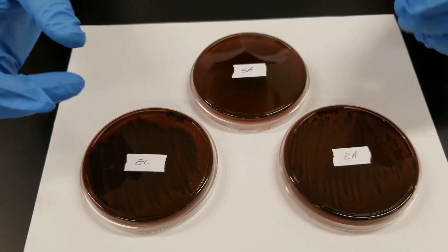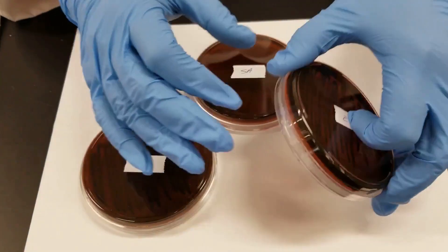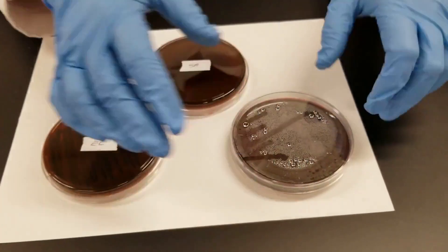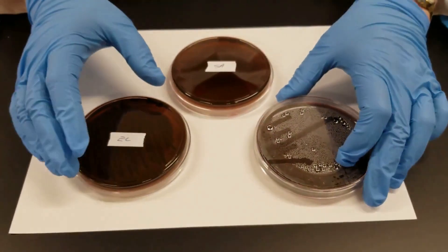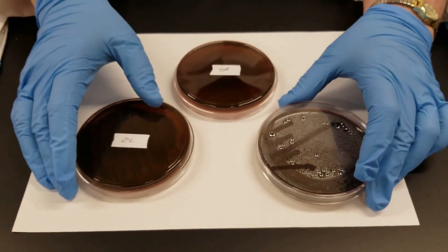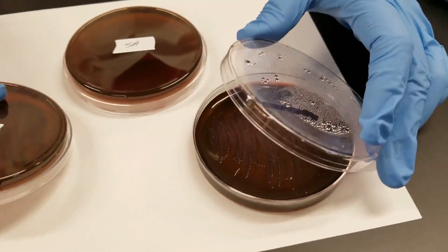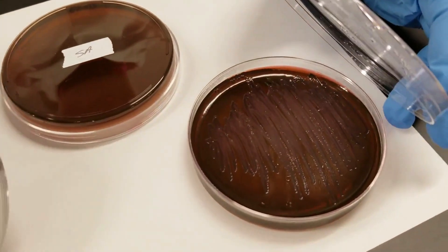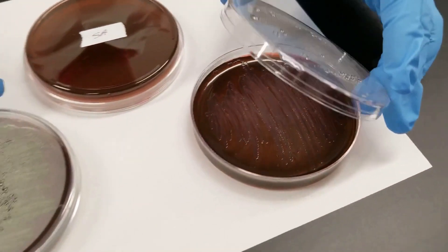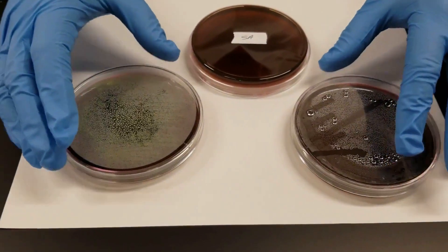Here is the differential part. I'm going to open the lid so you can see these well. This plate is the Enterobacter aerogenes. As you can see, there is growth but no coloration to it — but there is growth, so that confirms it's a gram negative.